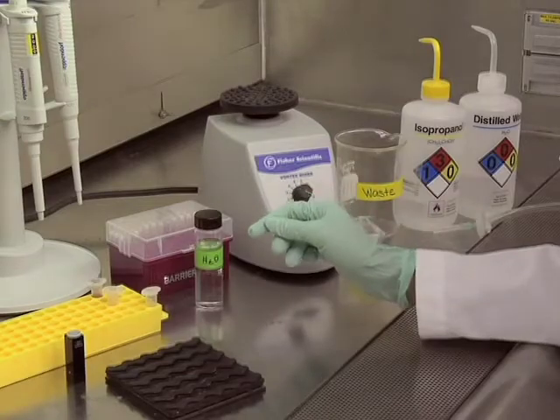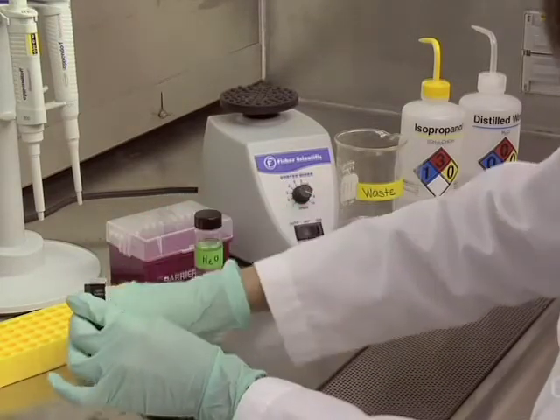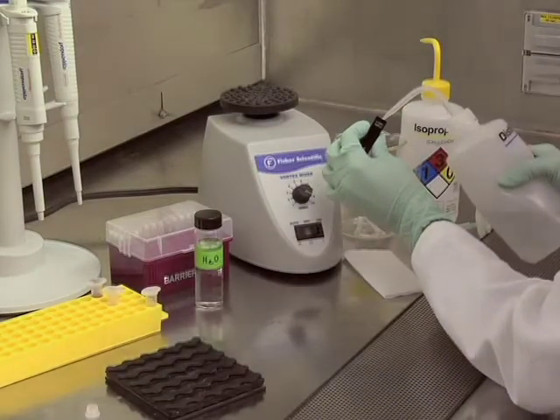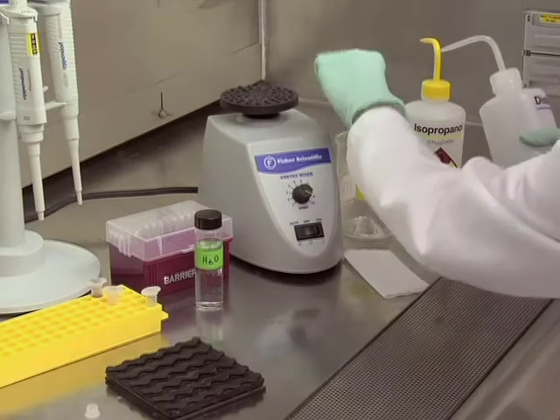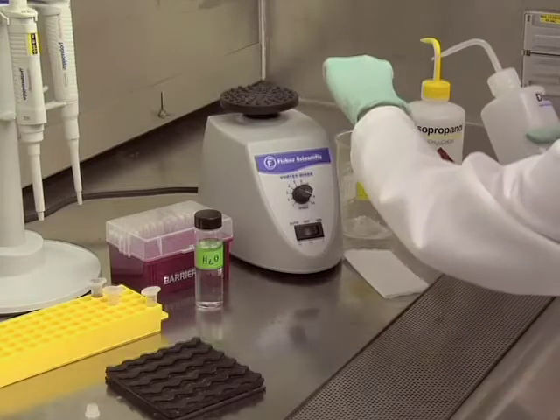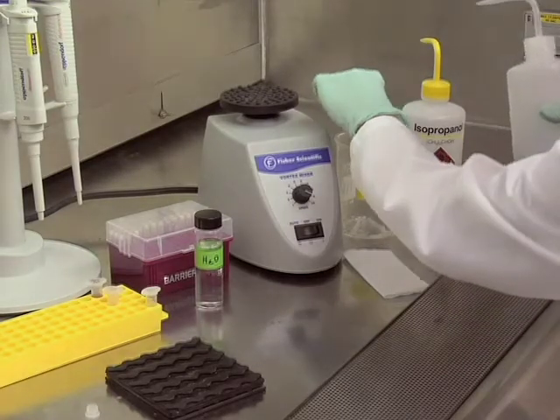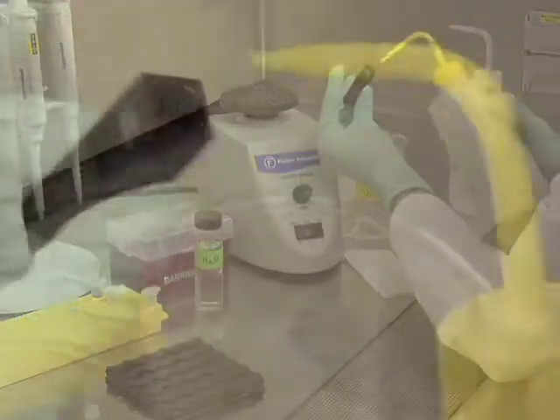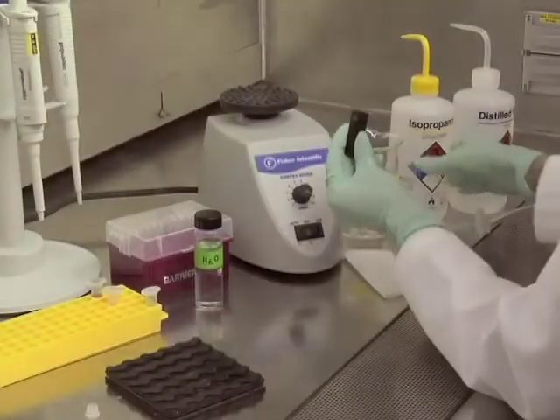Now I am ready to clean my cuvette. I will do this by rinsing it several times with distilled water. The cuvette we are using has quartz windows. Alternatively, a cuvette with optical quality glass windows can be used. Cuvettes can accommodate different sample volumes ranging from 10 microliters to 1 milliliter. Choose the appropriate cuvette capacity depending on available sample volume and instrument requirements. I will then rinse once using isopropyl alcohol and dry using nitrogen gas.